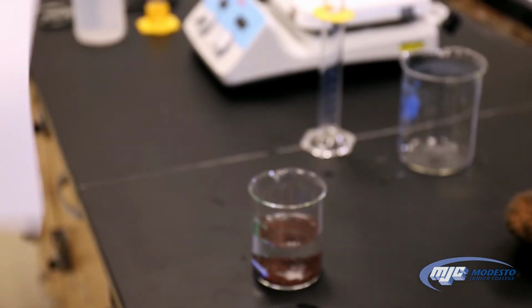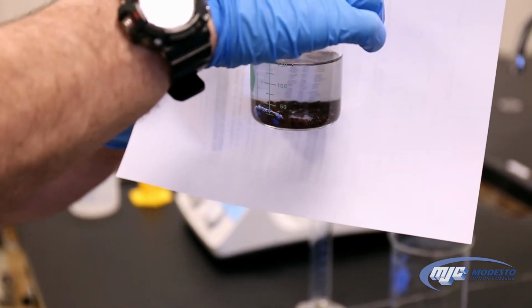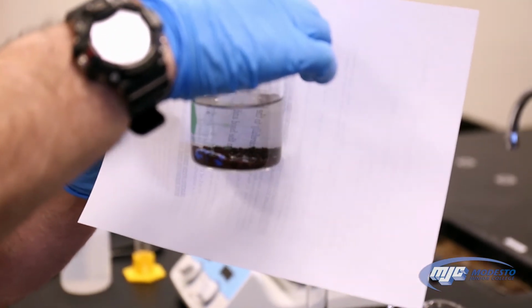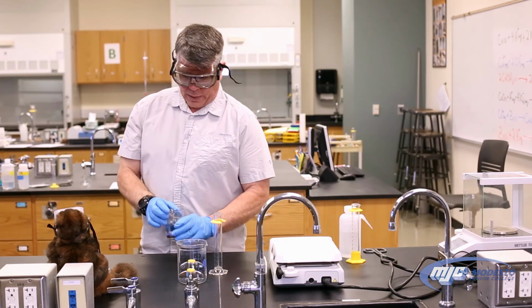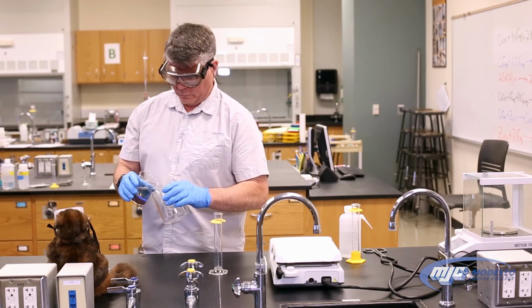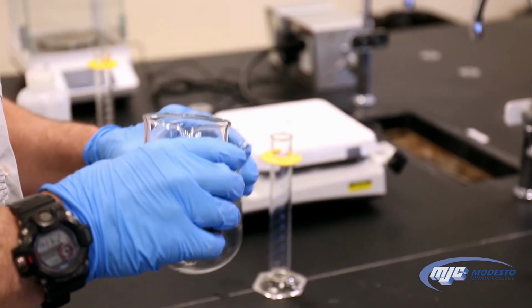All right, guys, so now we know that the reaction has finished. All of the copper(II) ions have been converted into copper metal, that brown stuff at the bottom, because there is no blue in the solution. It's pretty good. We've got all the blue out. So now we're going to decant the liquid off the top. Try not to let any of the copper get transferred over. This is our waste beaker still.